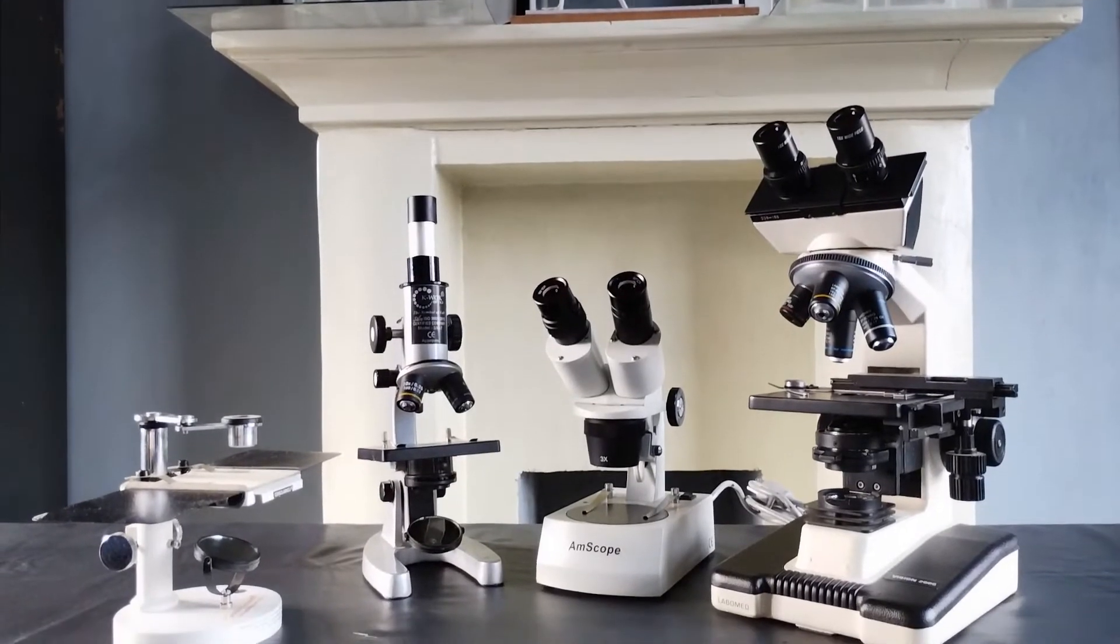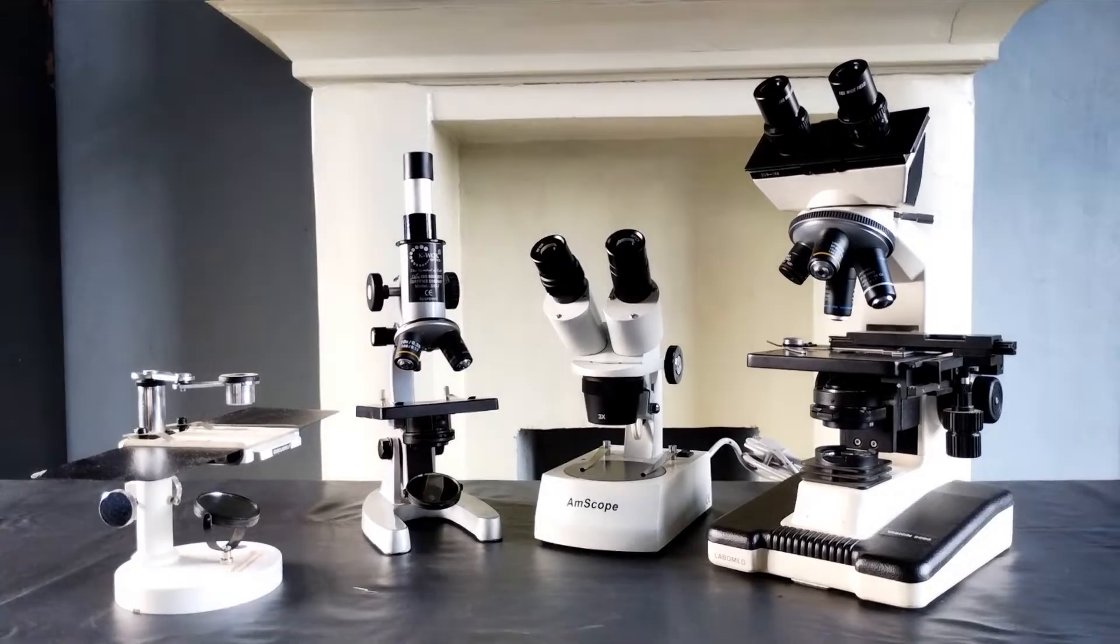Hello and welcome to a new video on the subject of microscopy. I'll be covering in detail in a separate video the working principle details of the component parts along with other important aspects of a compound brightfield light microscope. But for now, I thought I should make a short and practical oriented last-minute checklist kind of video on how to quickly set up a compound monocular brightfield light microscope for specimen viewing and study.